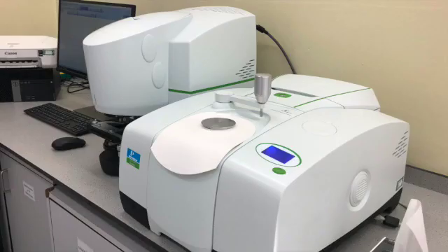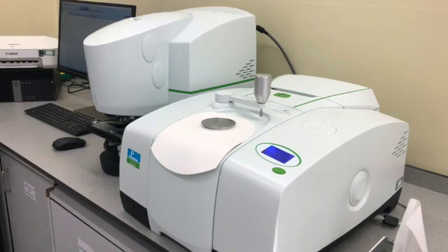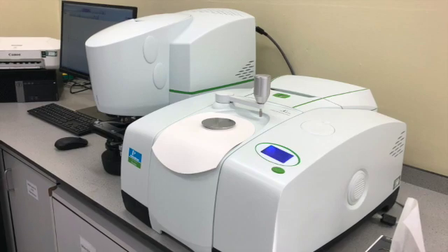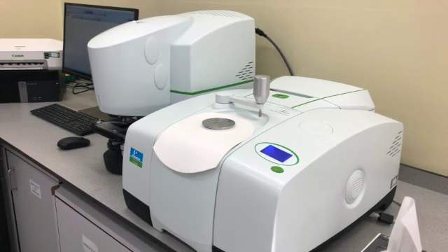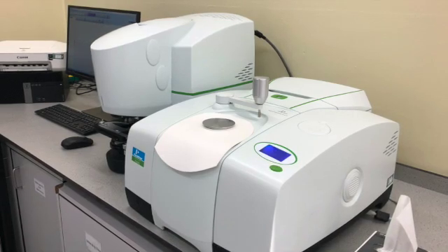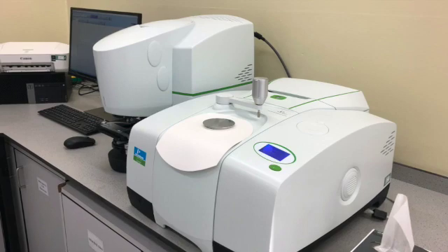Part 4: Paint Analysis by FTIR ATR. What you can see here has been shown in one of the previous videos, but what we have in front of us is the FTIR microscope on the left-hand side and the ATR component on the right-hand side, which would be the flat component on the side.